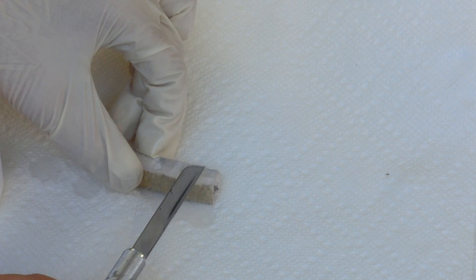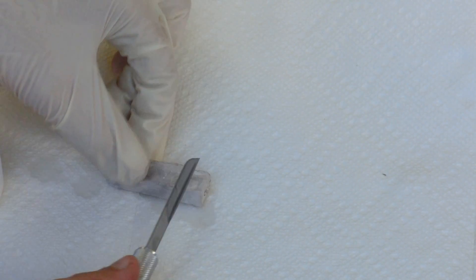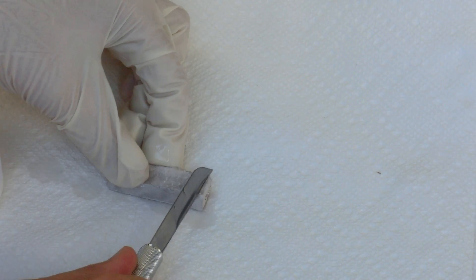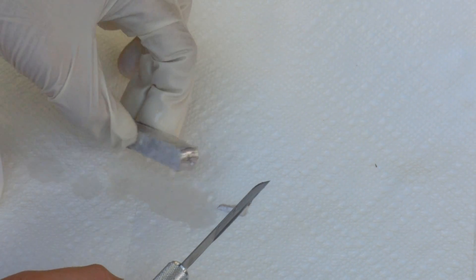Just from exposure to air, it will build up a white to gray oxide coating, but when freshly cut, you can see it's a nice, very silvery color.